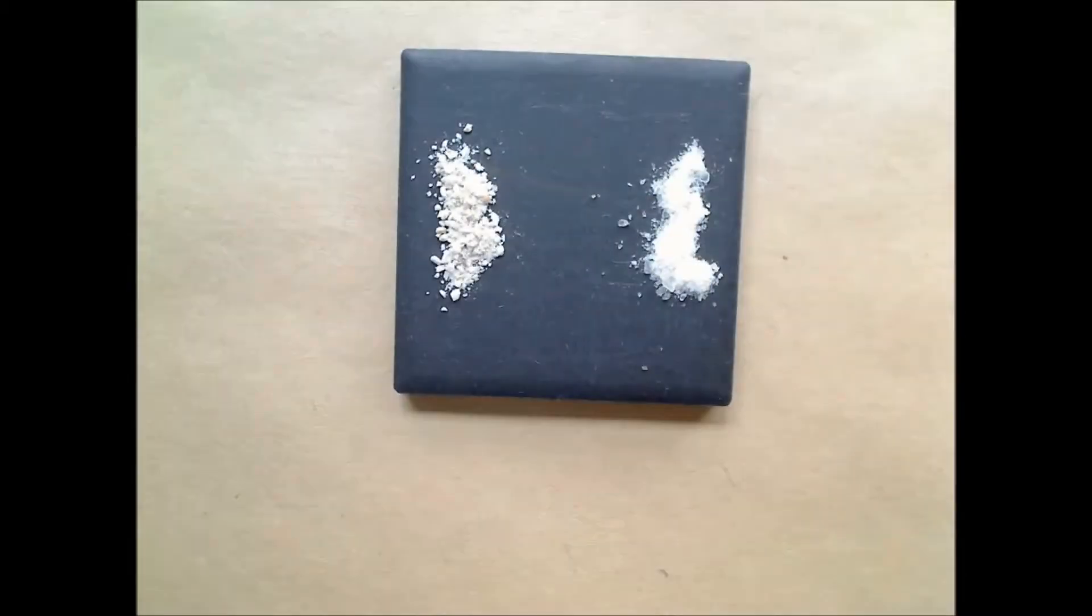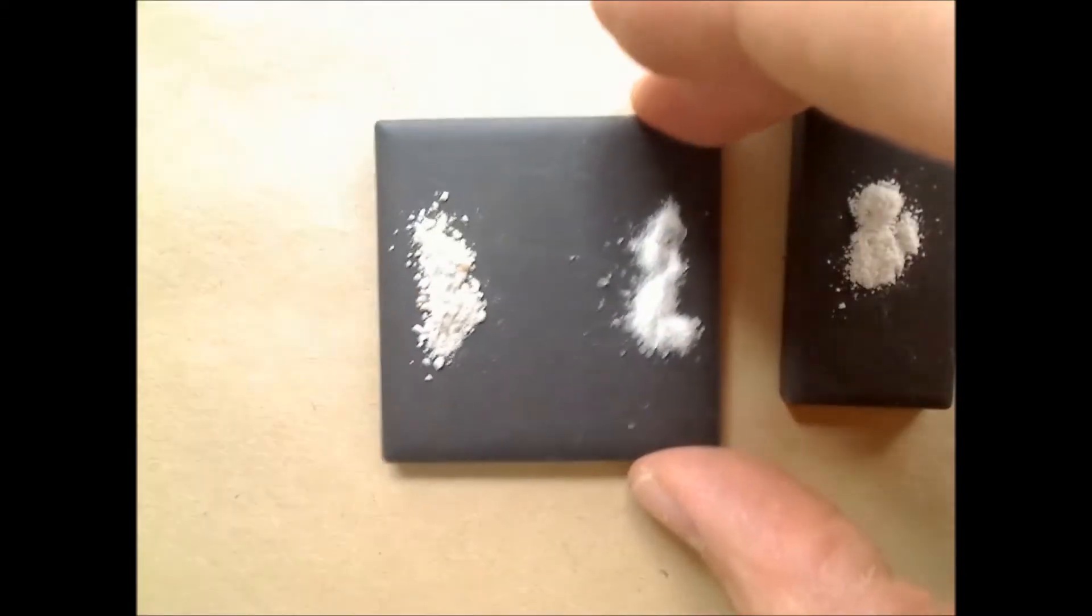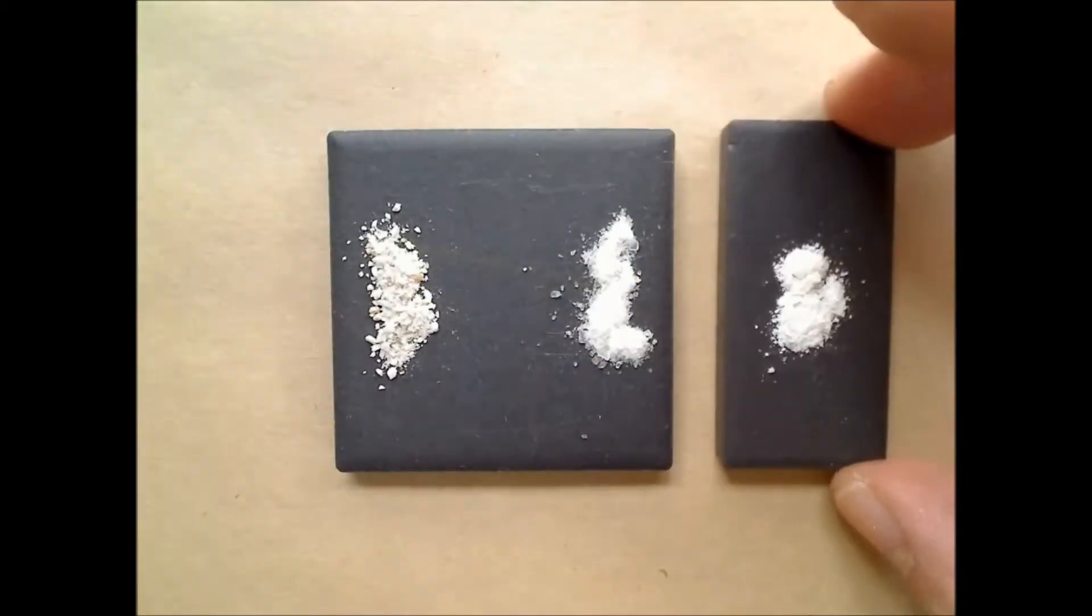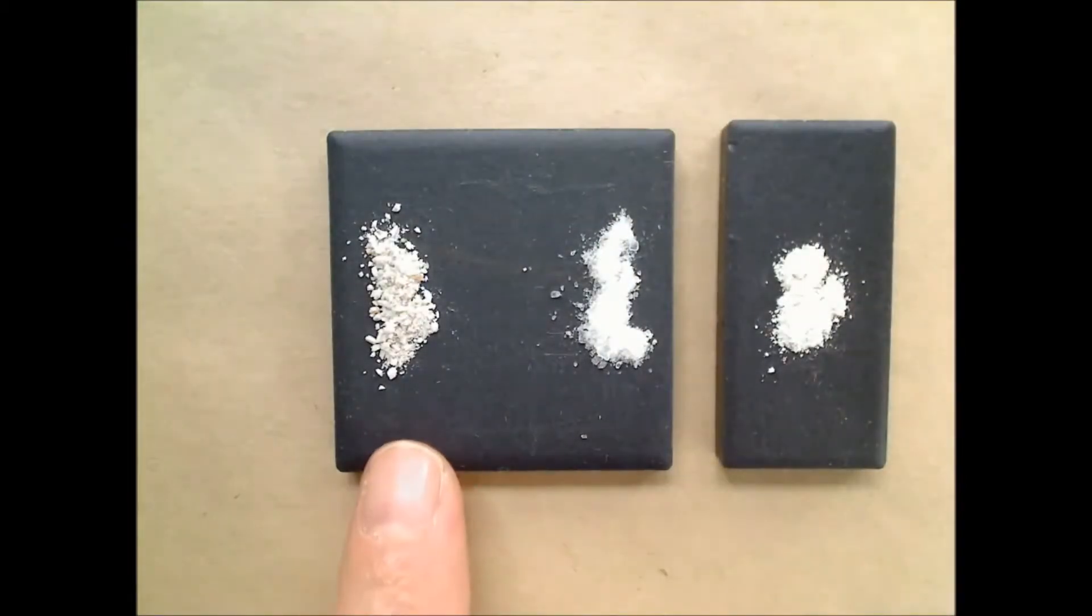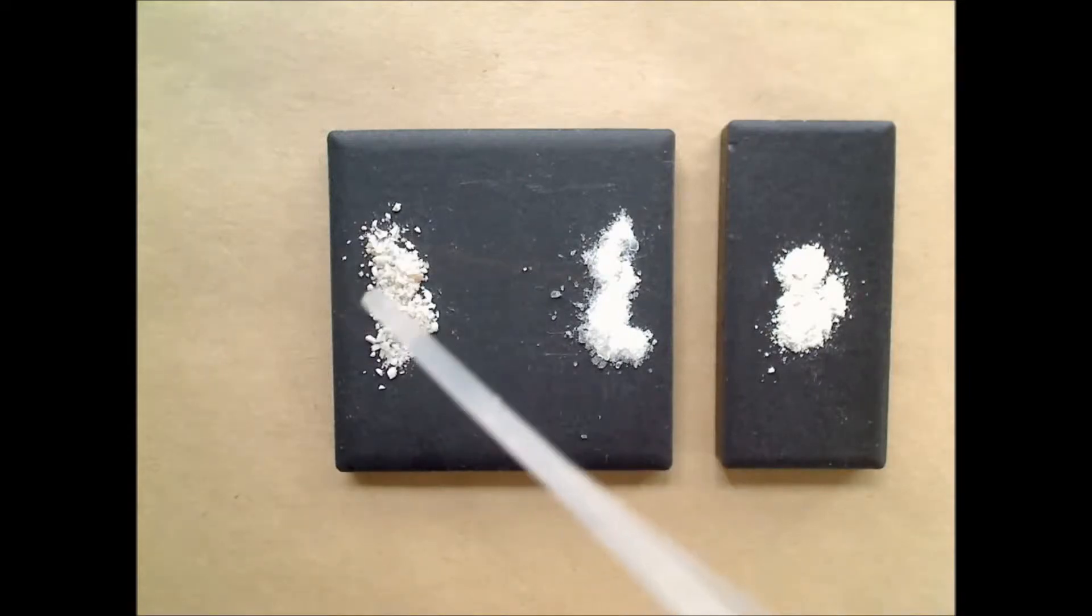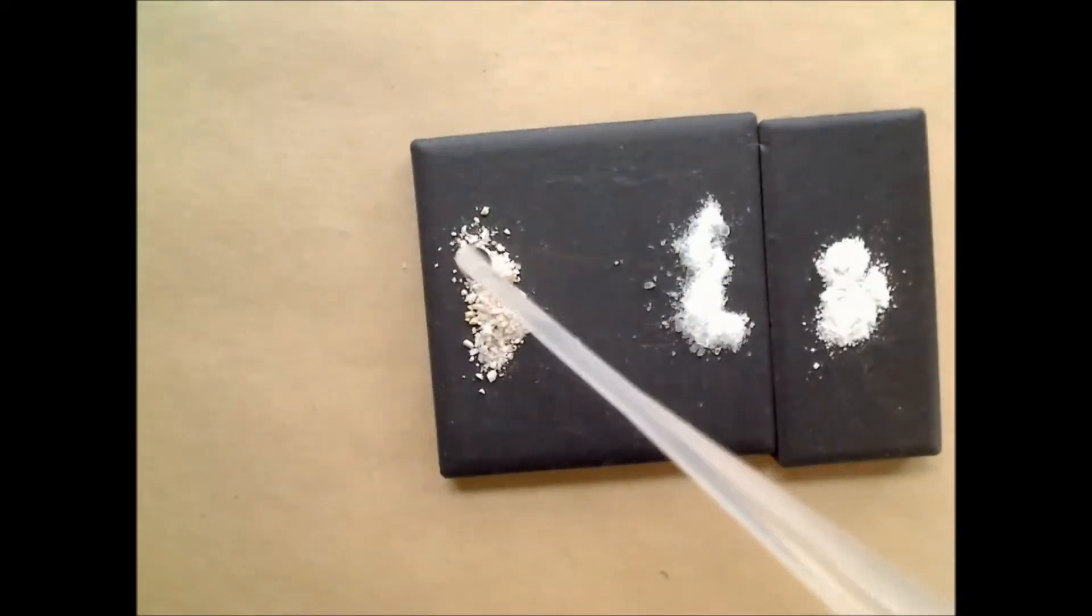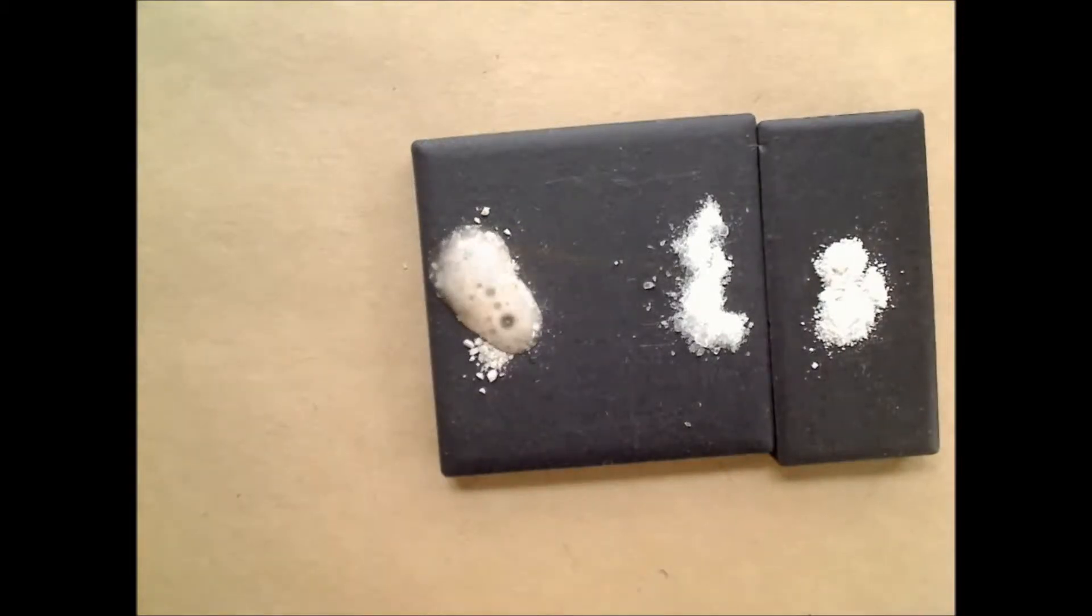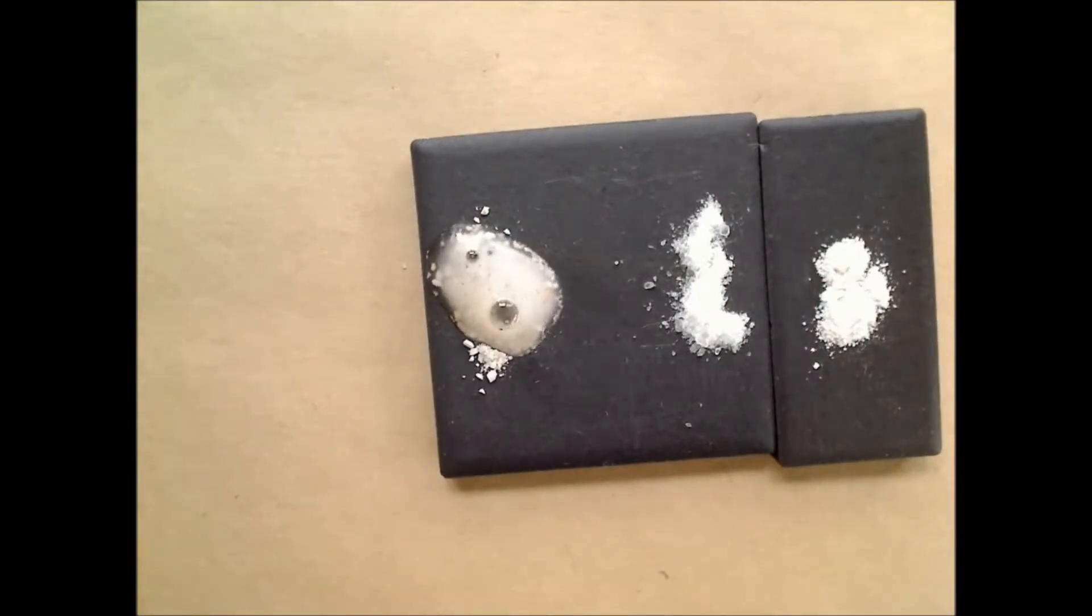Now I have some crushed up pieces of mineral. What I have right here is crushed up or powdered dolomite. And I'm going to drop some acid on that as well. Oh, you really can see that fizz quite well. So now the powdered dolomite, you can see that reacts.